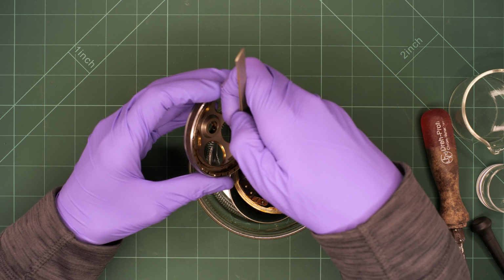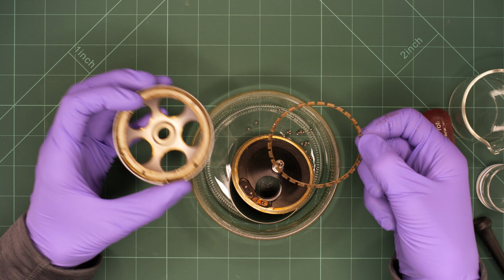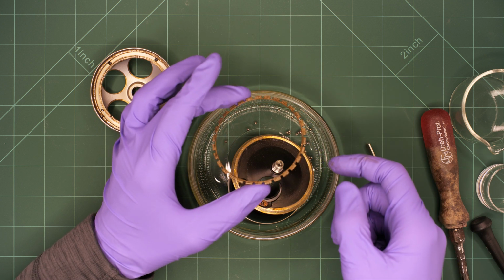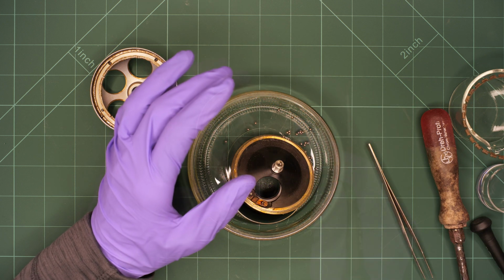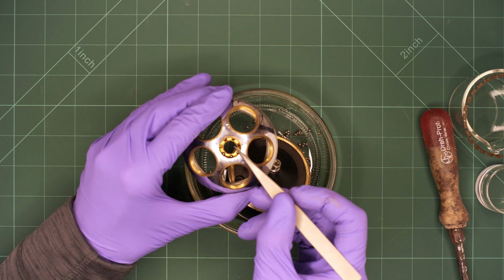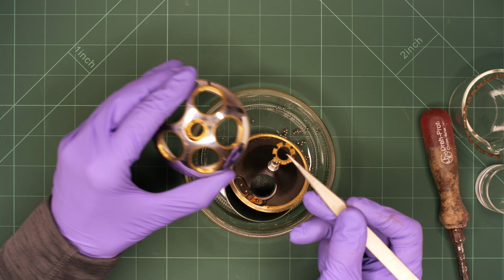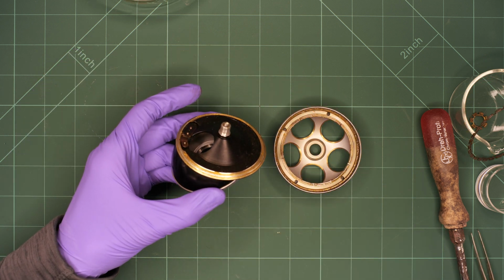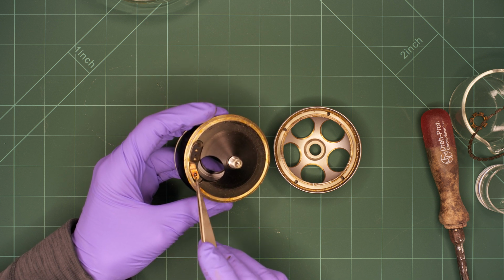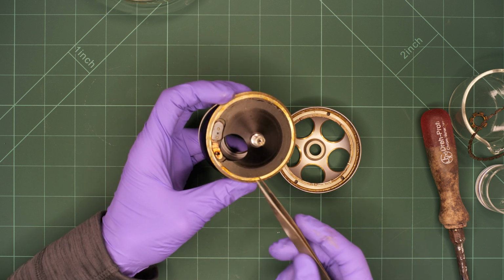I place all the metal balls into the container and also remove the brass ring, which can easily be lifted. I also remove the small ball bearing and its brass ring. We can now look at both halves of the nosepiece. What we shouldn't forget is the last metal ball that is held in place by the indentation in the spring steel. This ball locks the nosepiece at the specified locking points. We remove it and add it to the other ball bearings.